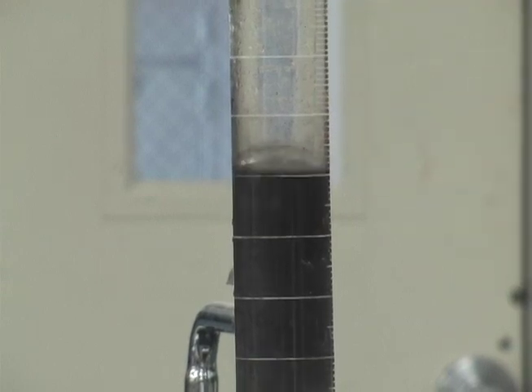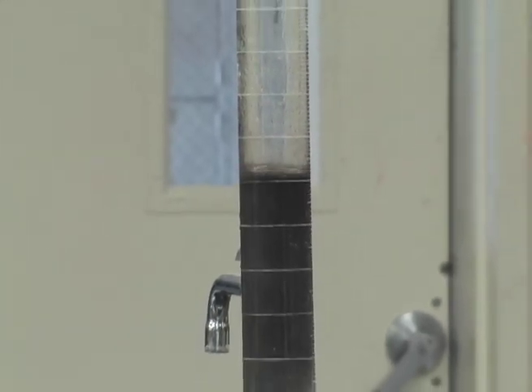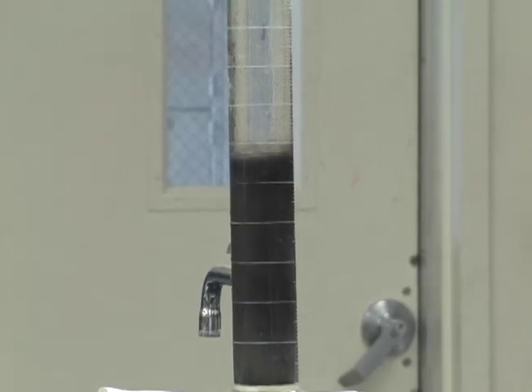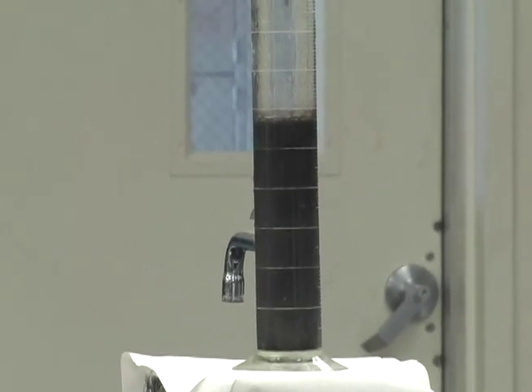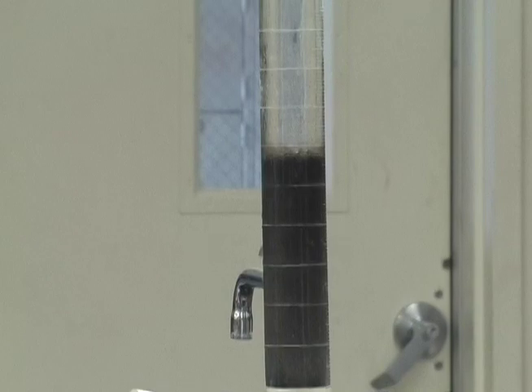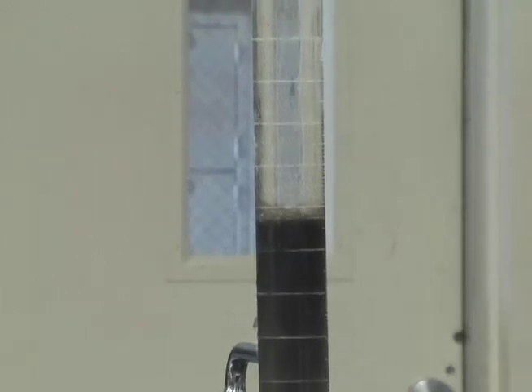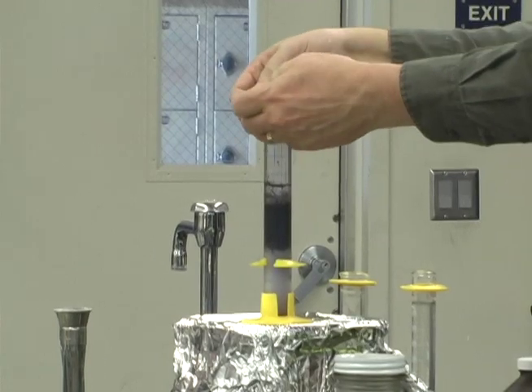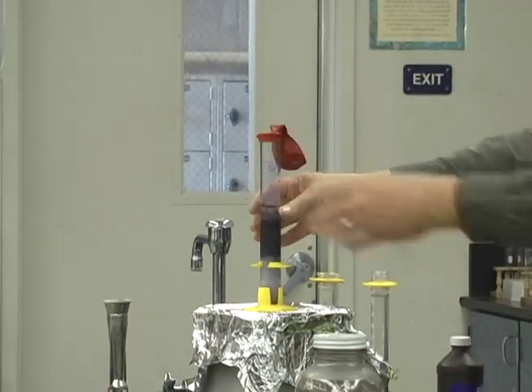So, if we want to get the reaction going, we've got to jazz it up with some hydrogen peroxide. So, you can see it starts bubbling. It's right in the balloon. Let's see if it's going to dance.